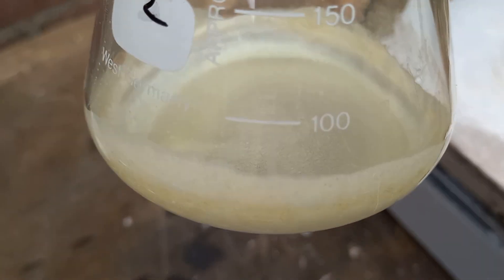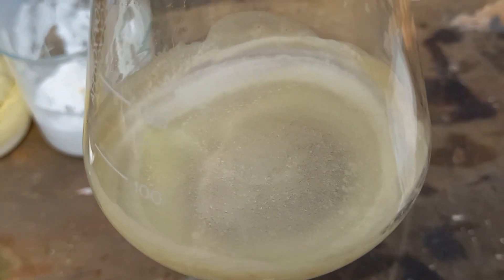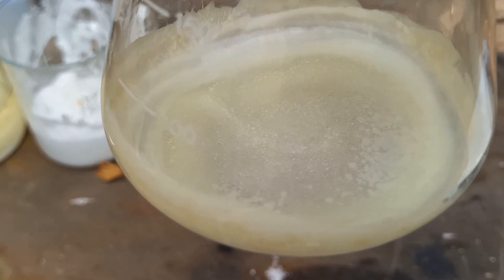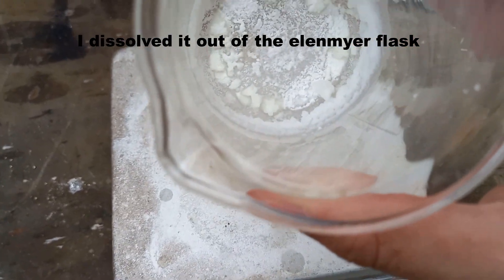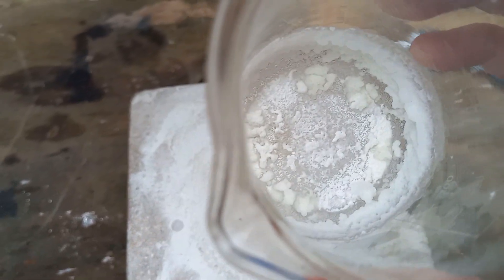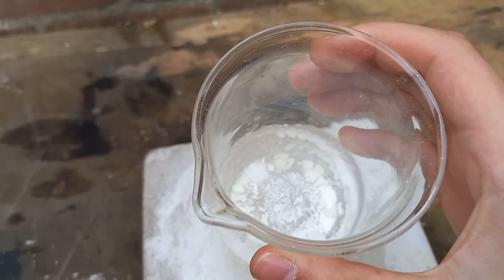This is probably a reasonably concentrated nitrite — it's probably a mixture of potassium and sodium nitrite. I don't think it's good enough for diazotization or whatever, but I hope it is — that would be kind of cool. So now we have this, which is hopefully very pure nitrite. It looks pure. It needs to dry a little bit more.